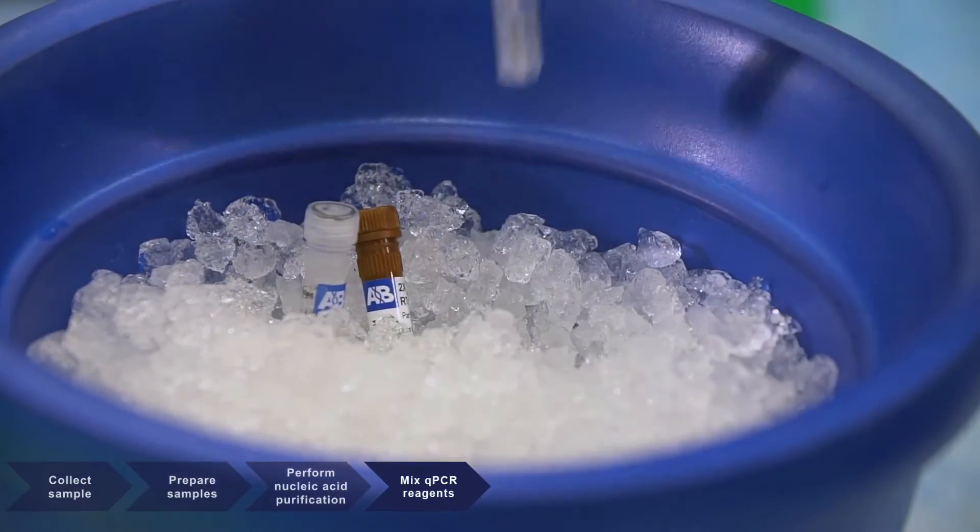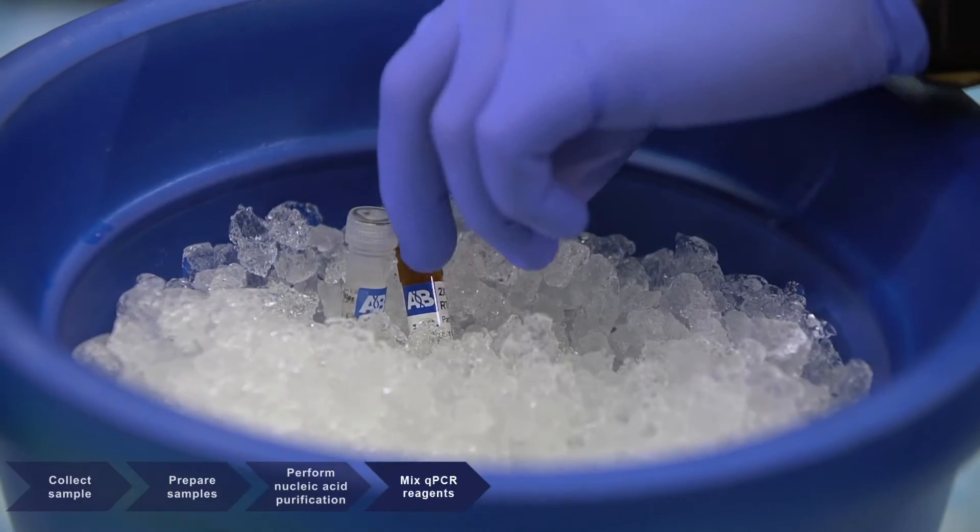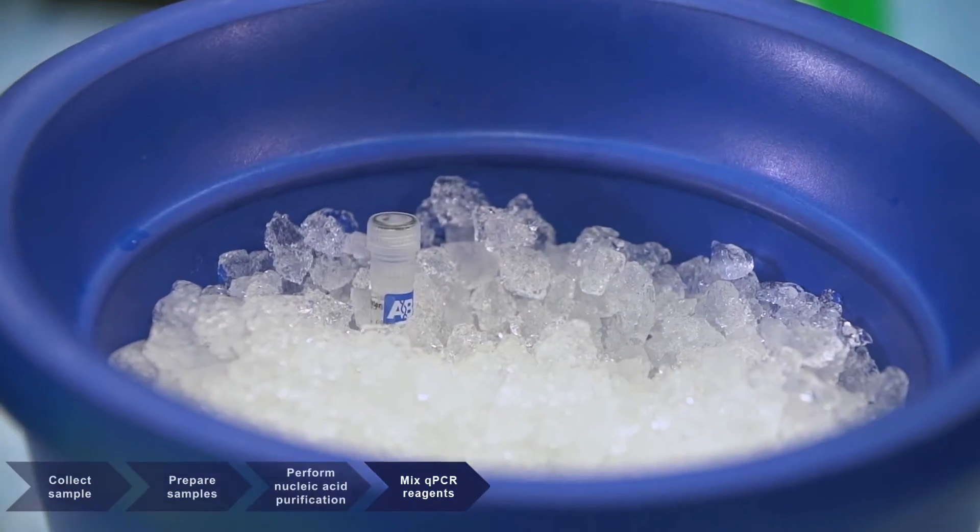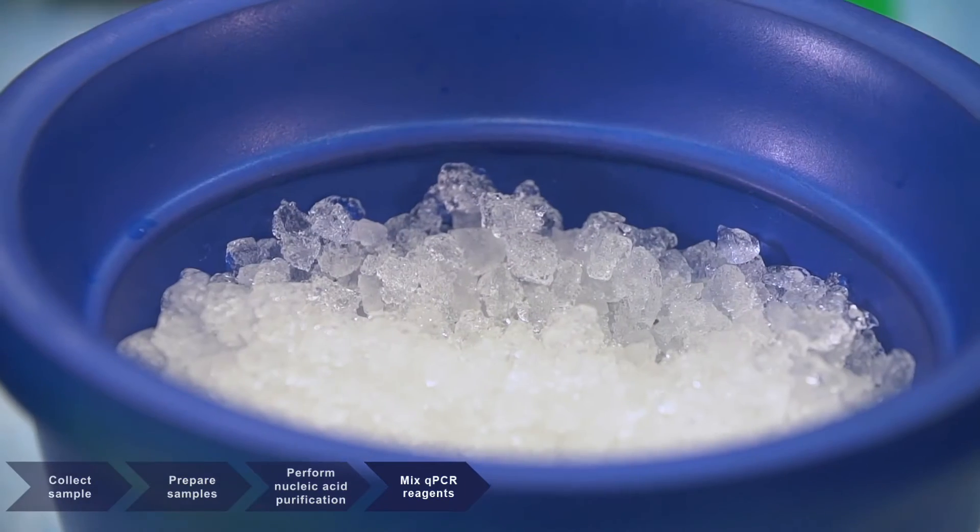Prepare the master mix by mixing the PCR buffer, enzyme mix, TaqMan probes, and PCR primers. Prepare negative controls using the nuclease-free water.